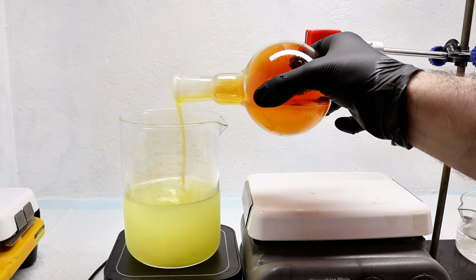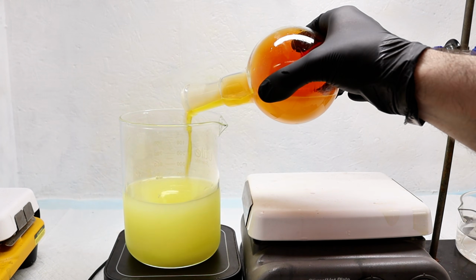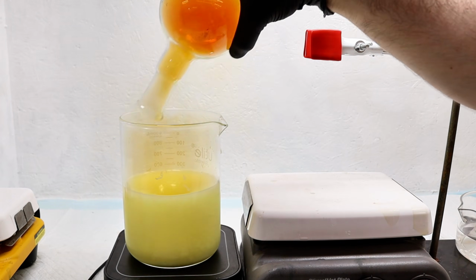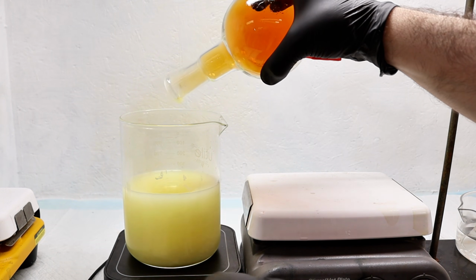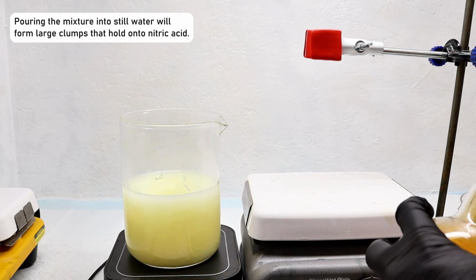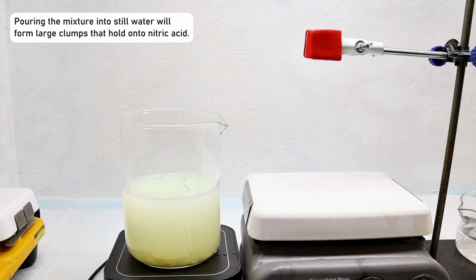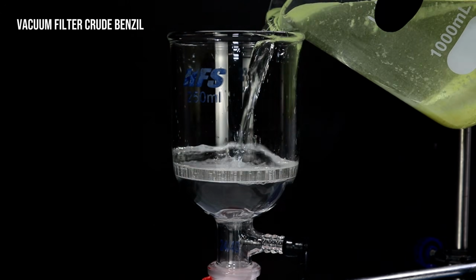By the way, as you can see here, I kept the cold water bath stirring aggressively, and I did this to help form a more uniform dispersion of the Benzil. In my trial run, I instead simply poured the mixture into still water, and this resulted in big clumps of Benzil that trapped a lot of residual nitric acid.